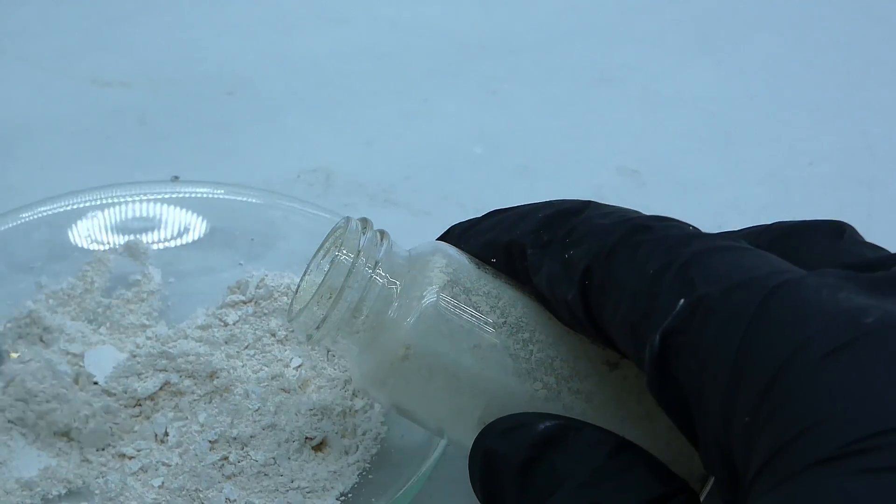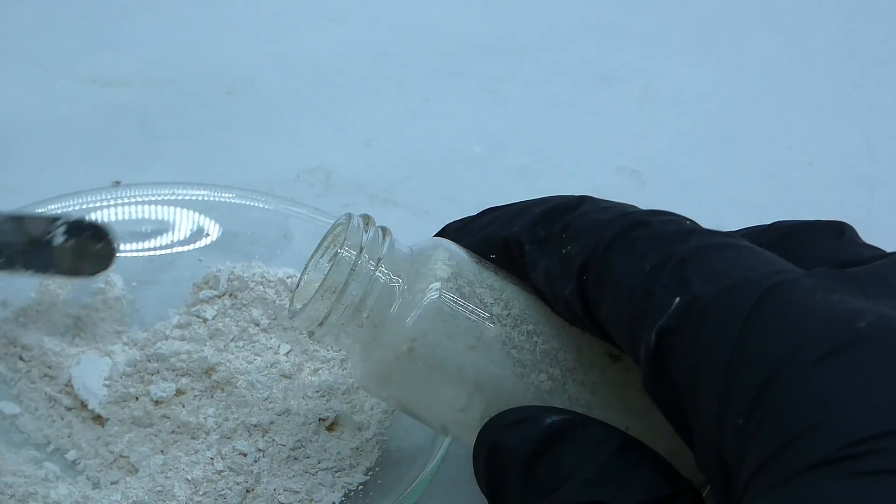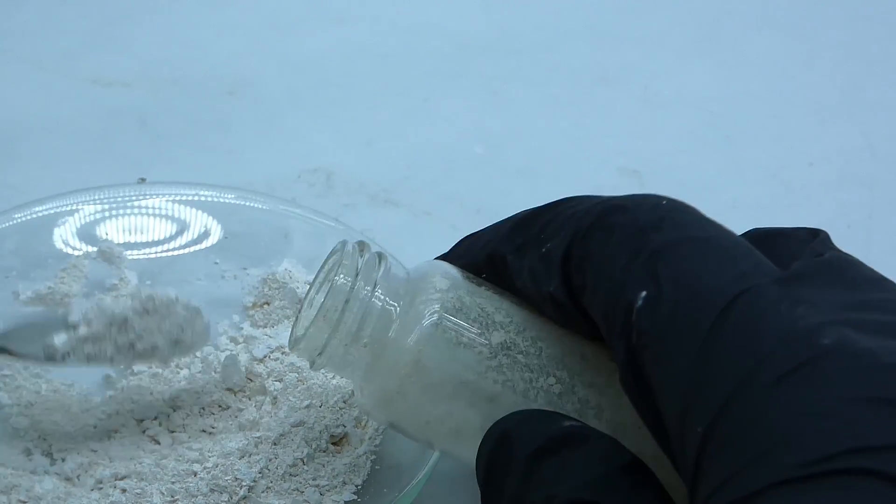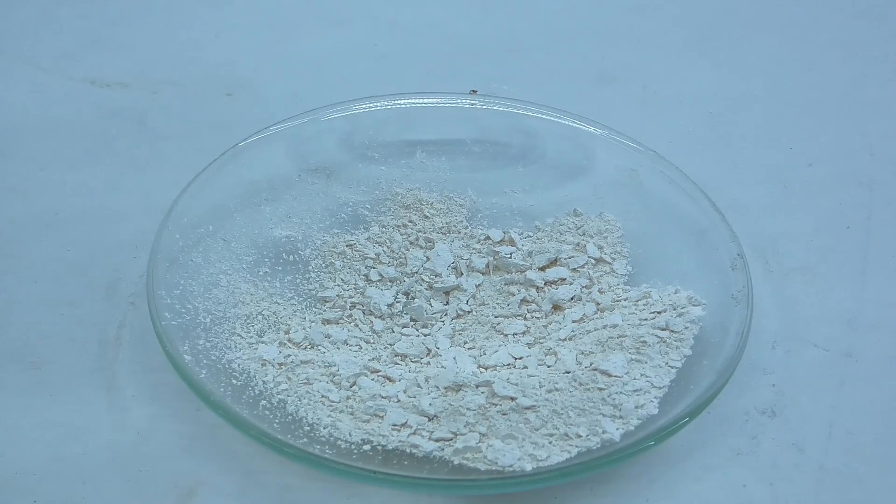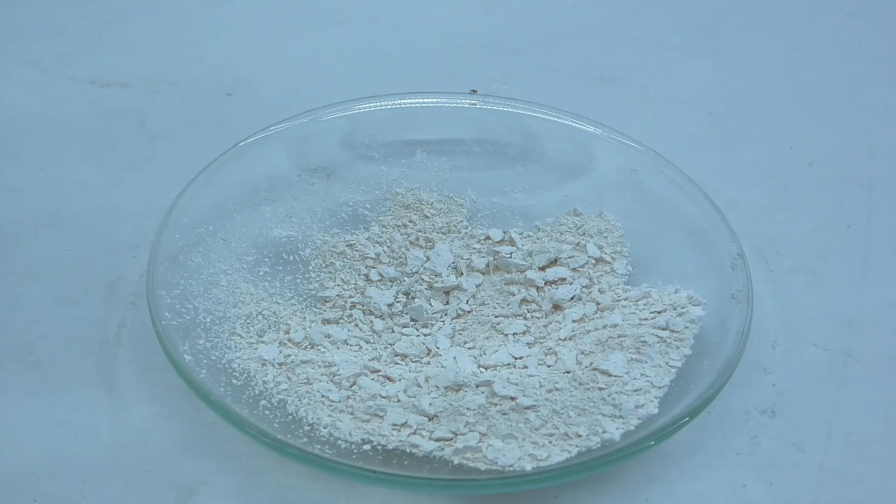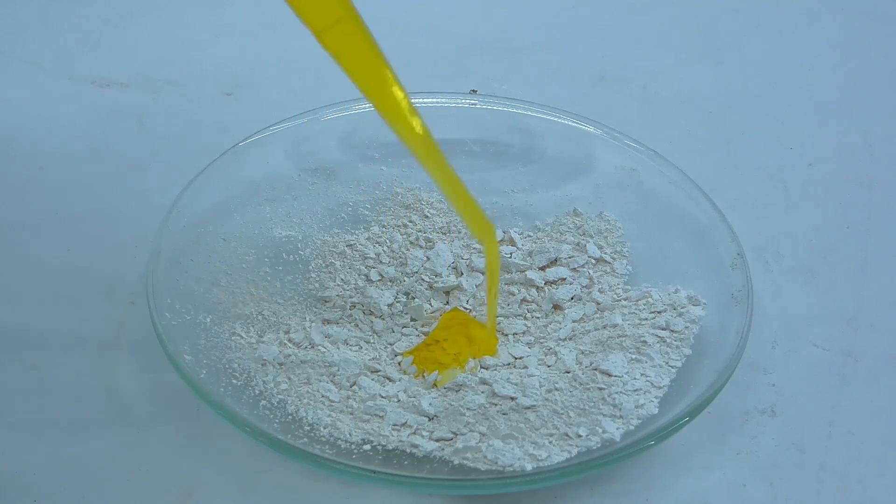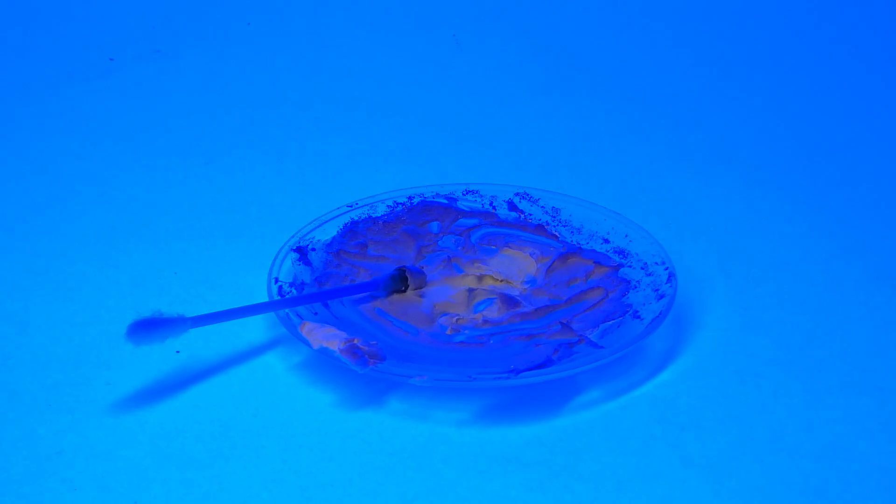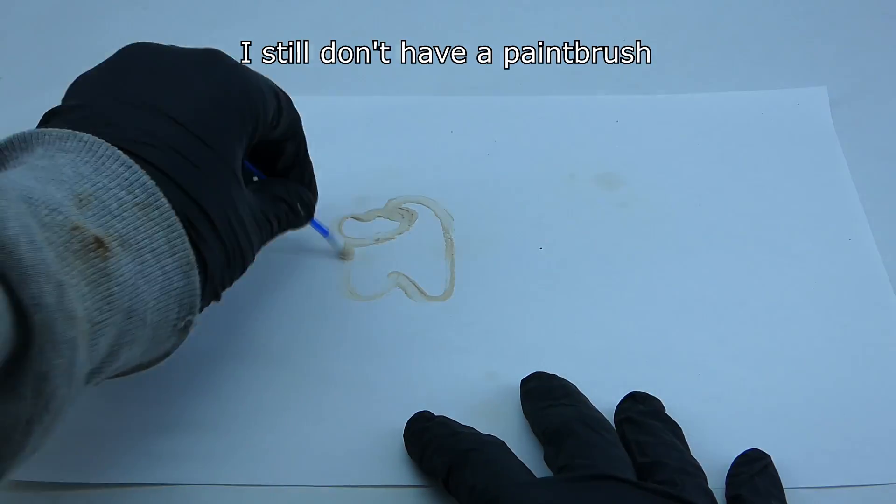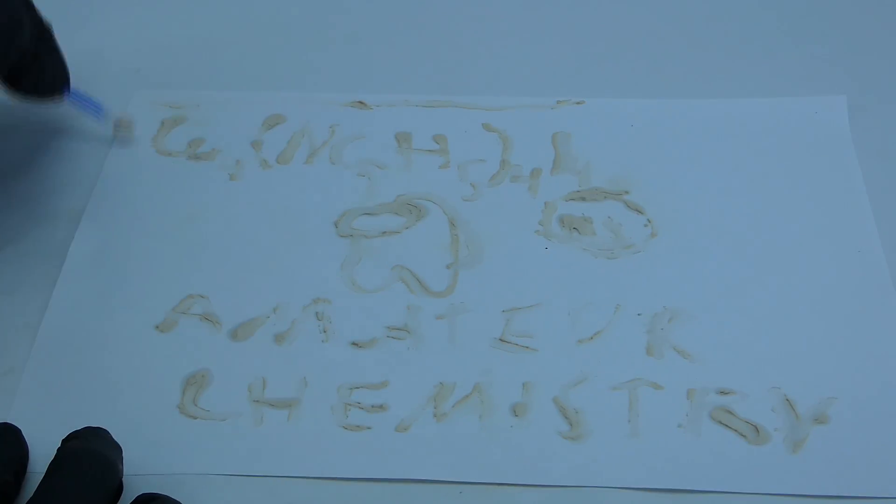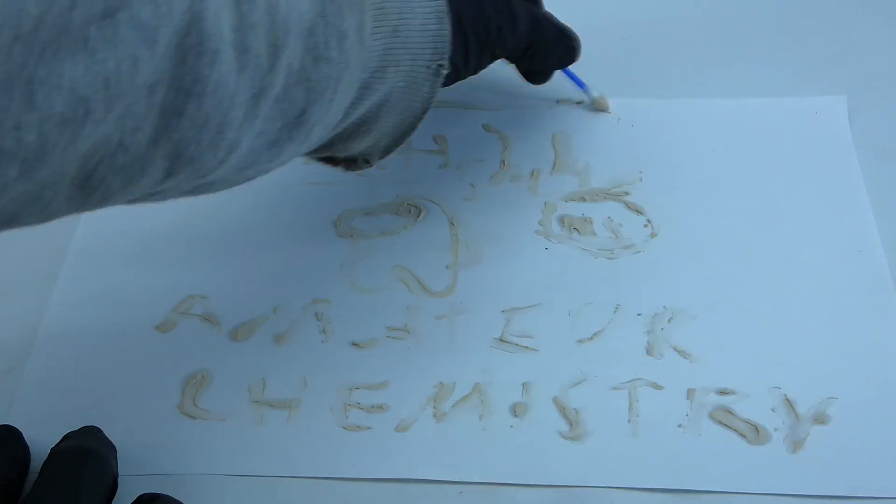I got some of it into a vial for long term storage, and I wanted to use the rest to make some fluorescent paint. I thought that if the powder glows very nicely when it's dry, it would behave similarly when mixed with linseed oil, but when I did that, it stopped fluorescing completely. I painted one of my cotton swab masterpieces with it and hoped that if I would dry it in an oven, it would glow again.